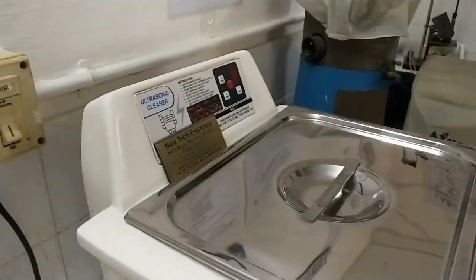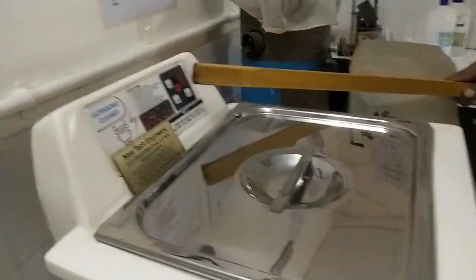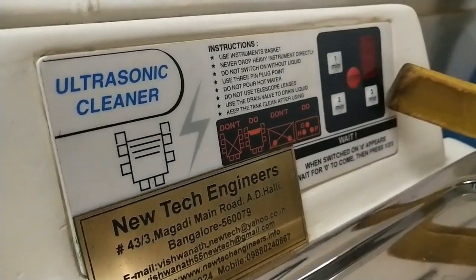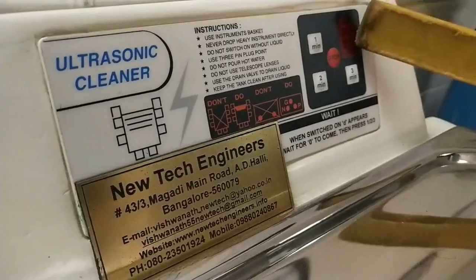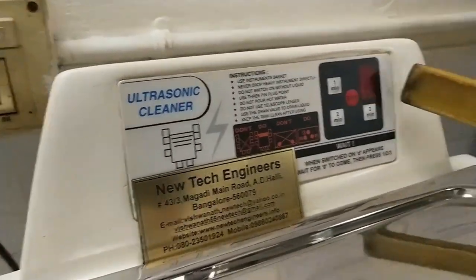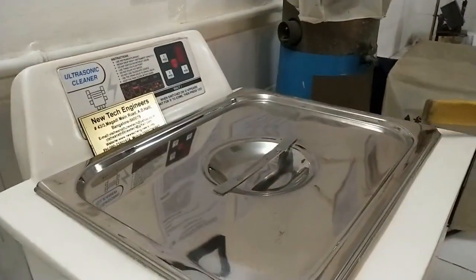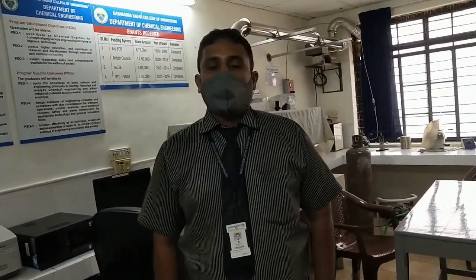We need to collect the samples at different time intervals. The time intervals can be measured by varying the time here. You can see 1 minute, 2 minutes and 3 minutes. We will be varying at an interval of 3 minutes up to 18 minutes. I will be collecting about 6 samples at different time intervals, and we will take out 10 ml of this mixture and transfer it to a conical flask containing HCl. The role of HCl here is to arrest the reaction between sodium hydroxide and ethyl acetate.